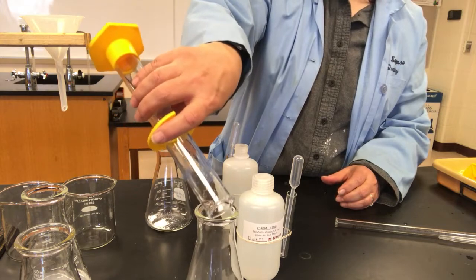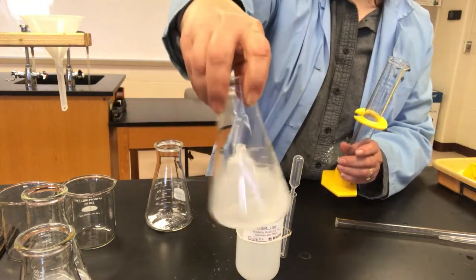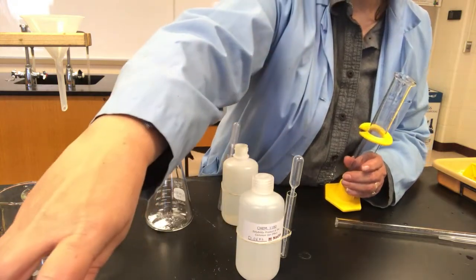Now you'll notice that my concentrations are not going to be terribly exact, and you might have noticed in my previous calculation I went ahead and rounded the Ksp to 2 sig figs.